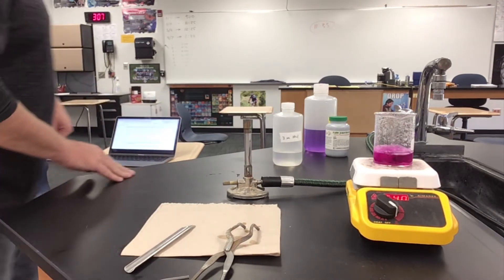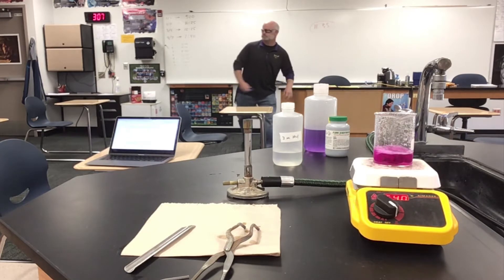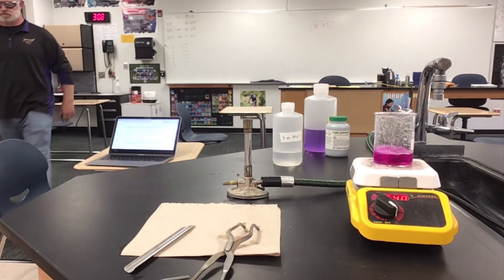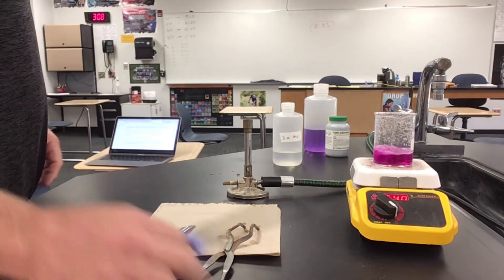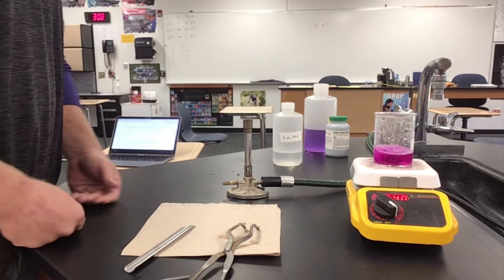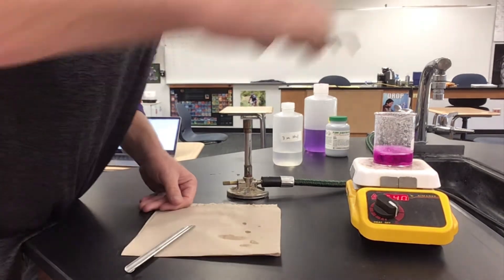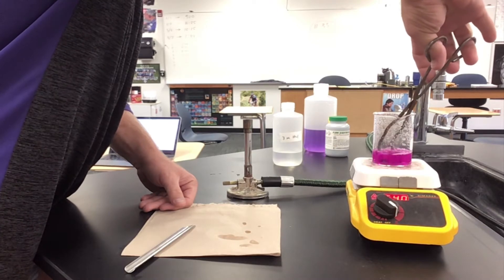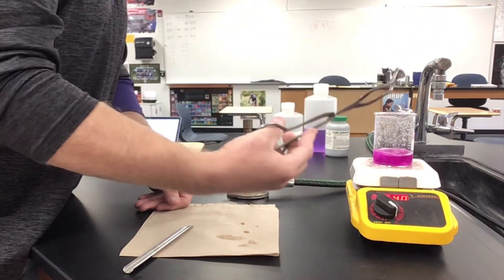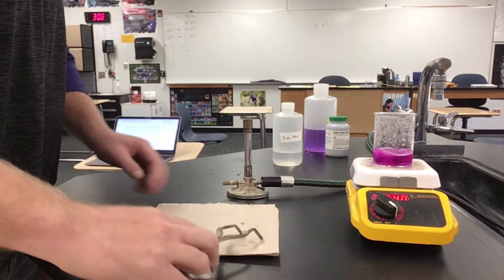I have three minutes on this, so in the meantime I'm going to get a lighter to light my Bunsen burner. All these things in our lab are timed out to provide enough time for the proper procedure to happen. The boiling is important because this needs to be at high heat — boiling is nice, it's in solution, it's controlled, but it's high heat. I'm a couple minutes in and I'm going to take a peek to see how it looks. We're getting a good result — the penny is now a very silvery color. I'll give it another minute to finish this process.